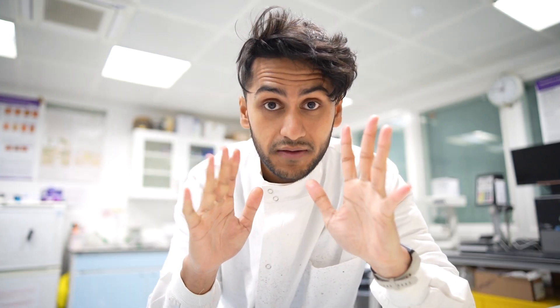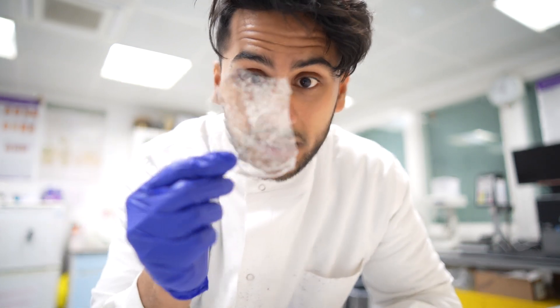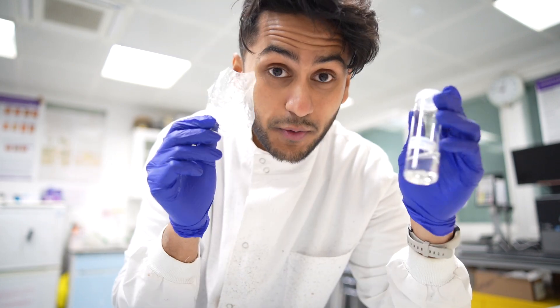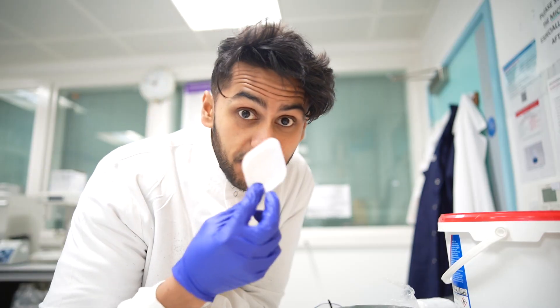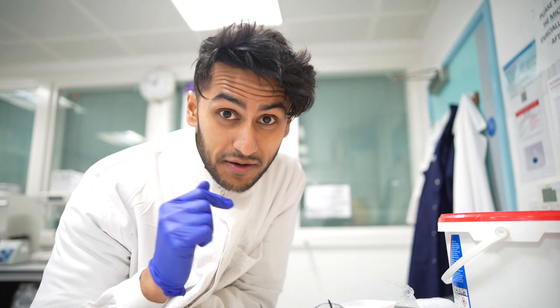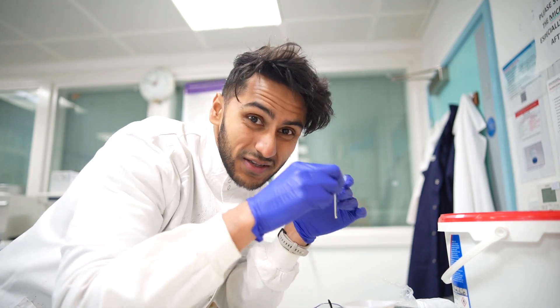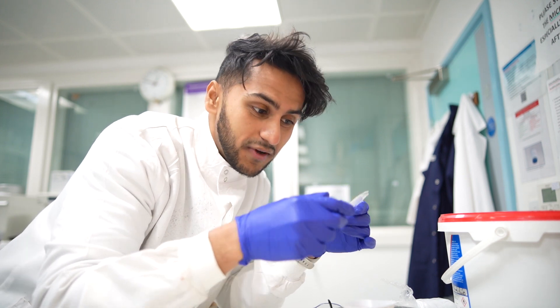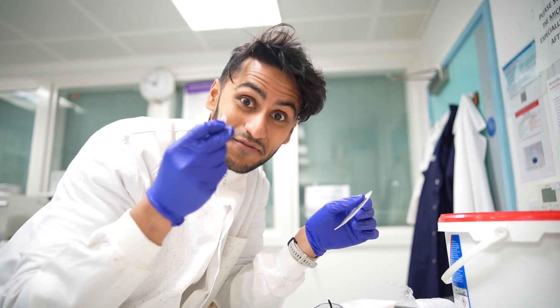So back with the gloves — this is the polymer they sent, very cool looking stuff. I'm going to break off two grams and put it into this solution. Actually I'm just going to do it with one vial, because I don't want to waste the polymer — I want to see if the viscosity increases. I have my weighing boat over here. Plop it on, put the scale on, make sure I tare it to zero. Because it's cold it's very brittle — listen to that cracking sound. That piece went flying, but yeah, it's very brittle right now.